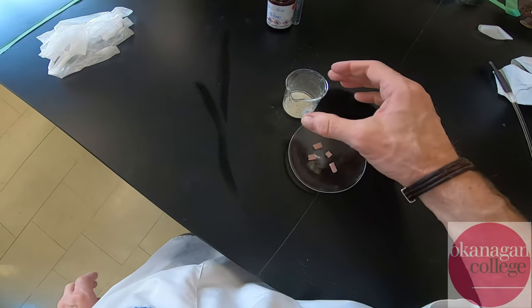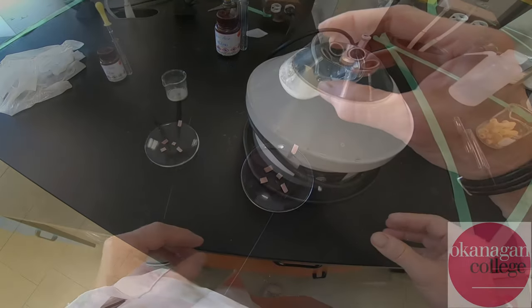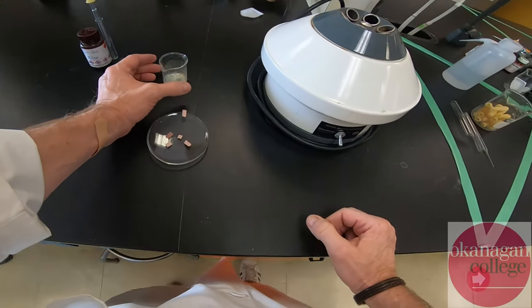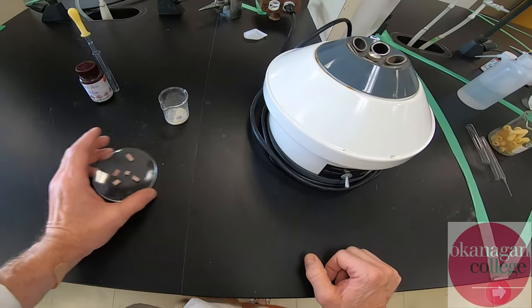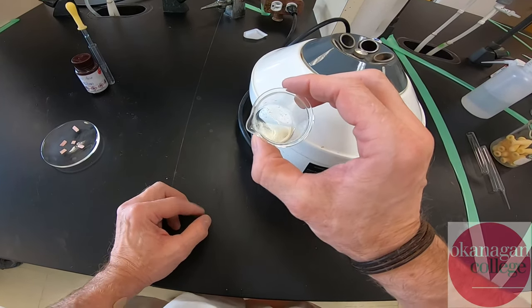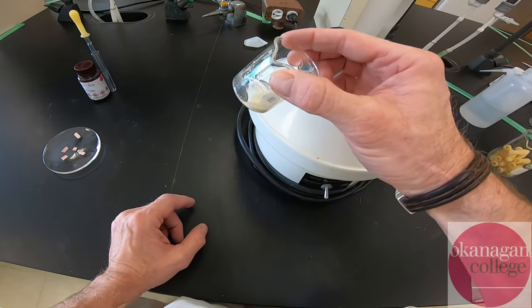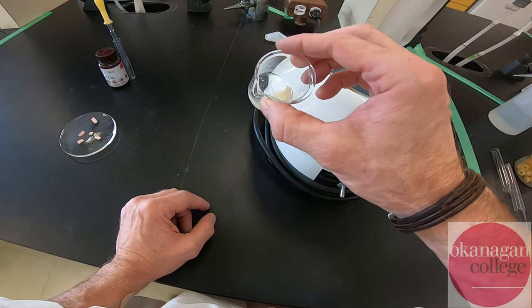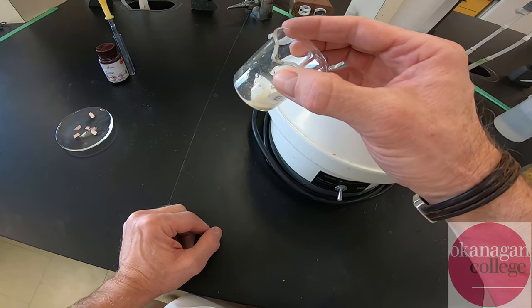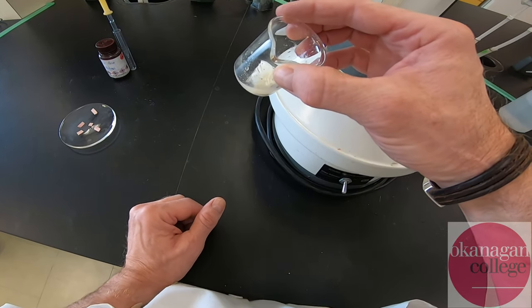This material is going to be transferred into a centrifuge tube and the fine solid is going to be separated out. The reason we're using a centrifuge: in years gone by in analysis of this material it's extremely fine and does tend to clog up filter paper. It's not unreasonable to use vacuum filtration, but in previous experience we found that the filter paper clogs and it's really an exercise in frustration. This seems to work quite well.